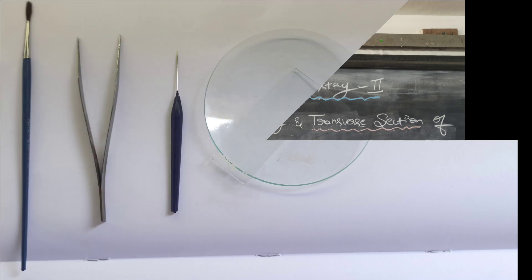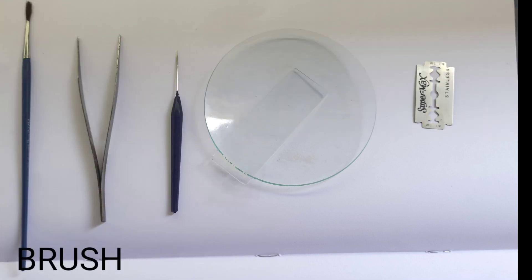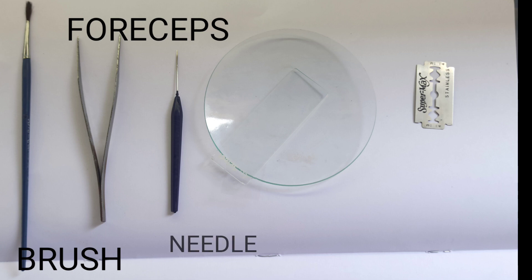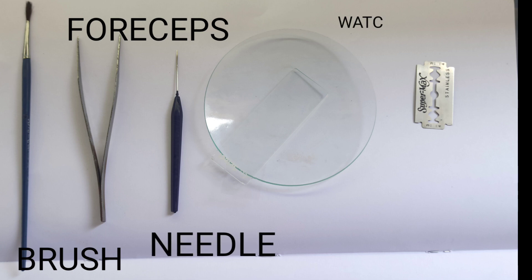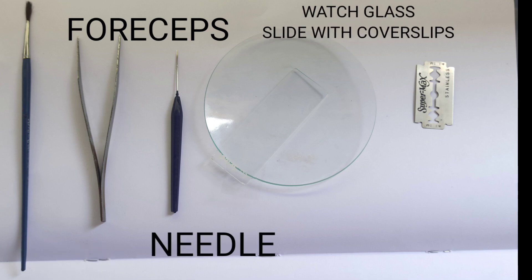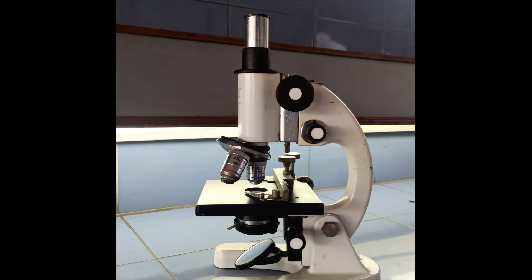Requirements needed to perform this experiment are: brush, forceps, needle, watch glass, slide with cover slips, sharp blade, and a microscope.